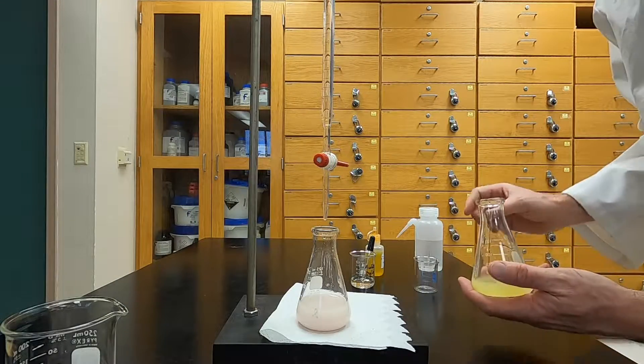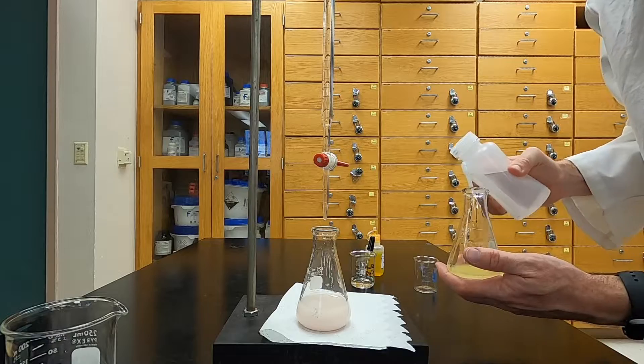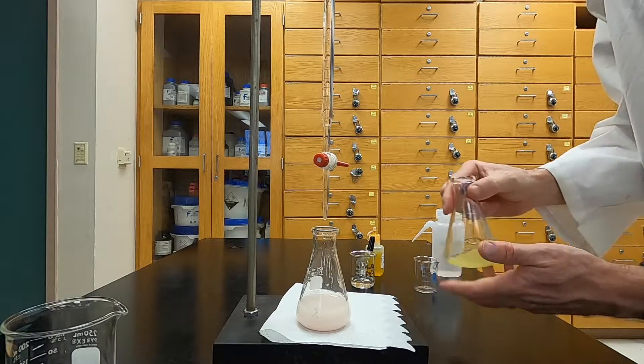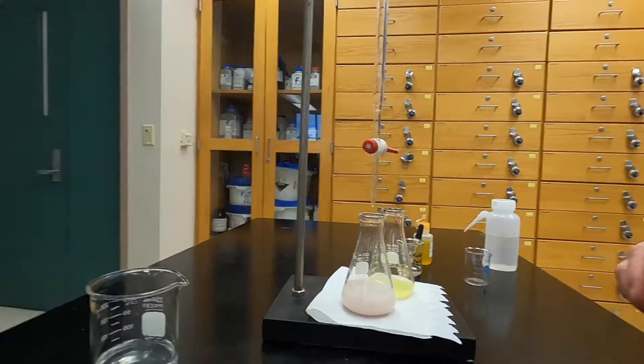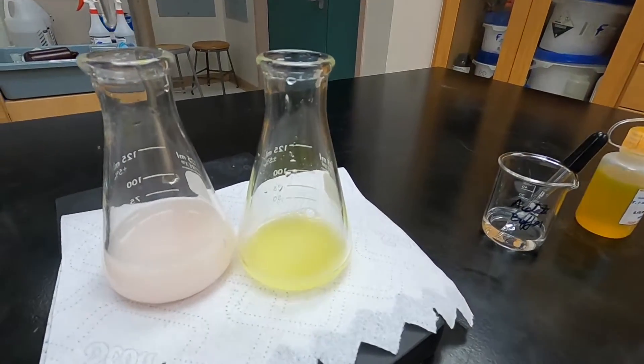Here you can see a comparison of a freshly prepared solution about to be titrated and the solution I titrated previously. Notice that the pink color is relatively faint, but the yellow color is very vibrant.